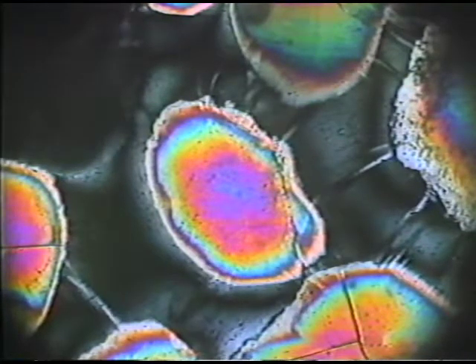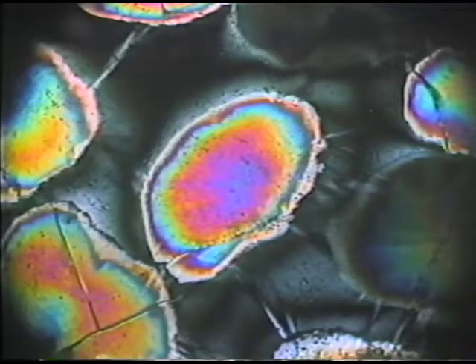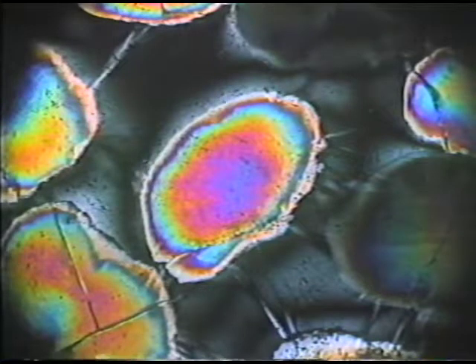So we can locate again, sometimes very conveniently, the slow ray using the quartz wedge. Now let me rotate this grain 90 degrees, and I'll show you the same test using the quartz wedge again, now on this grain at its illumination position 90 degrees previously. And now you can see that the colors move down slope. They move from the center of the grain toward the outside.